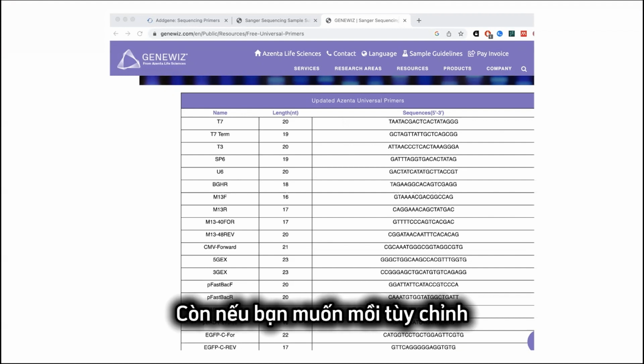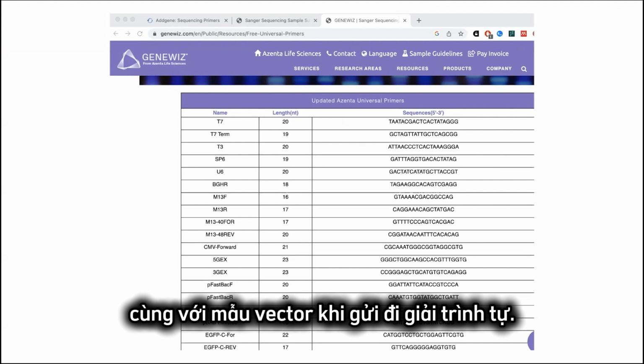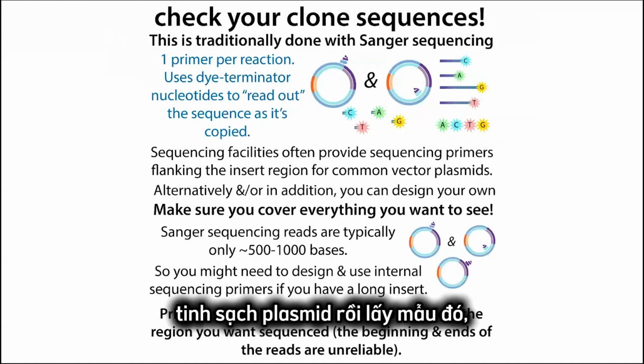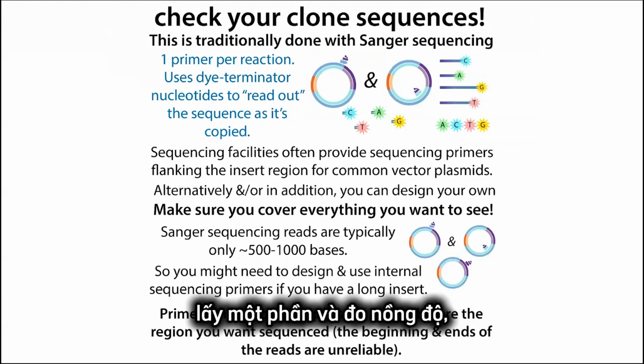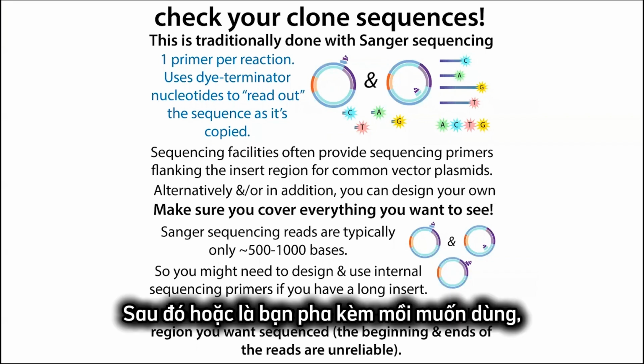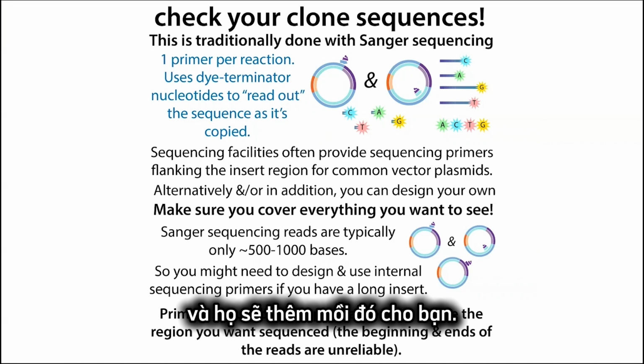Whereas if you want a custom primer, then typically you pre-mix it in with your vector when you send it for sequencing. And so typically what you're doing is you do some sort of mini prep, you purify out the plasmid, you measure the concentration, and you dilute it to whatever amount the company wants. Then you either mix in the primer that you want to use, or you tell them to use this general primer that they already have, and they'll put it in for you.